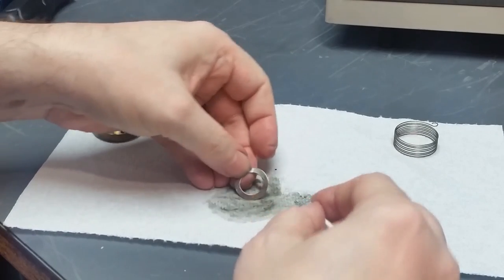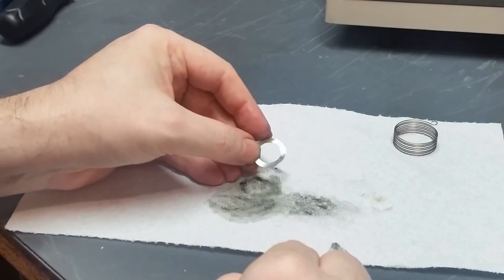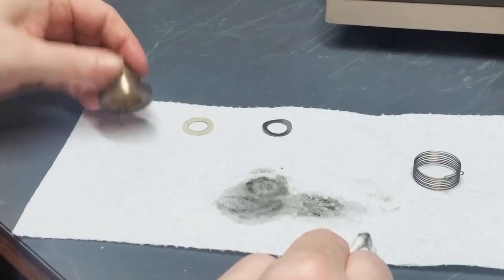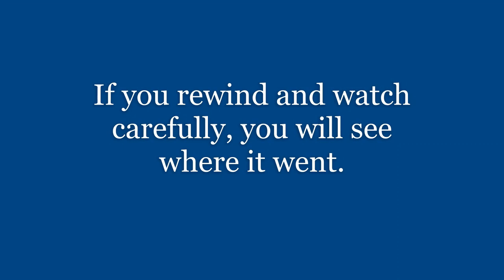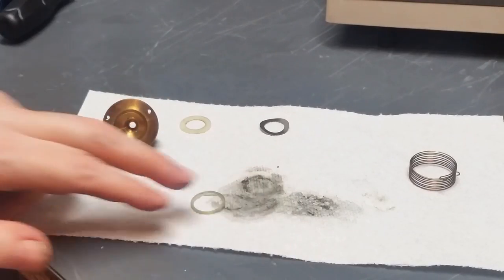Okay, I've got this pretty well cleaned up. You can see little wear spots on there, but not really any grease left over. This is in pretty good shape, doesn't need cleaning. I need to account for the one tiny little thrust washer that goes in here. For some reason it's not here. I'll be right back. Okay, don't ask me where I found it, but here she is.